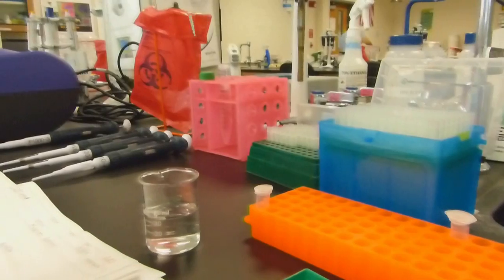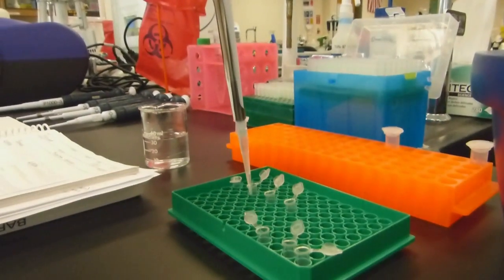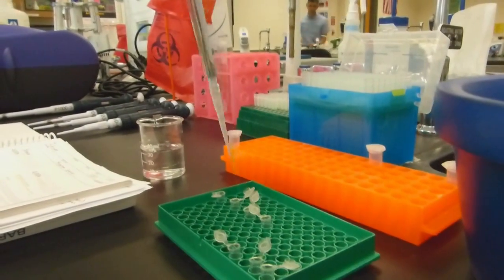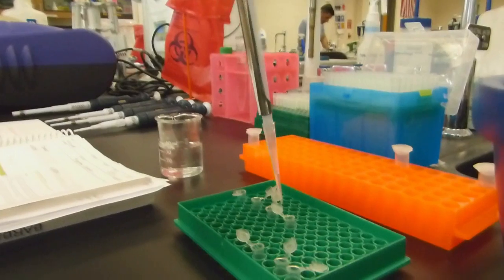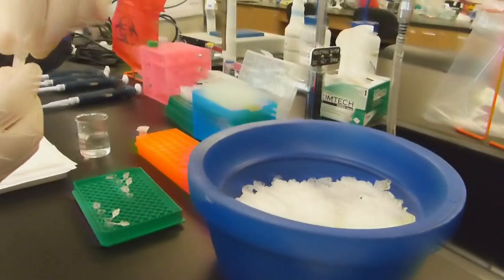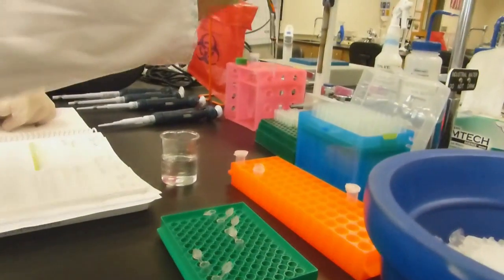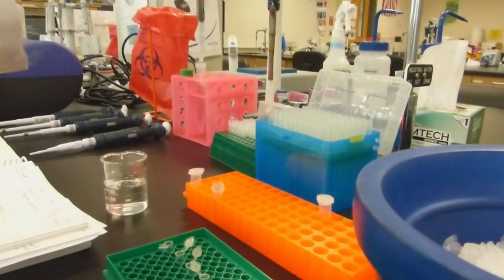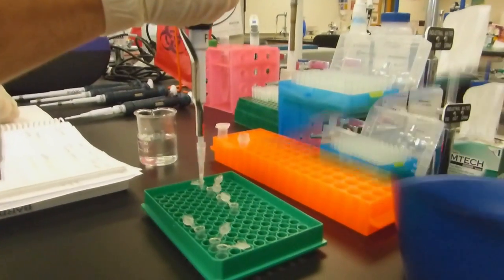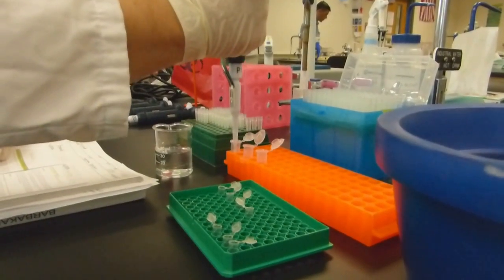Now it is time to load our tubes with everything we need for the PCR reaction to take place. Simple. Each of the 4 samples we will be testing for contamination will get exactly the same mixture. Here, we are first loading each of the PCR reaction tubes with 35 microliters of deionized water. Next, 10 microliters of the reaction mix that has the primers and dNTPs necessary for PCR to occur will be added. Make sure to change the pipette tip for each tube to avoid contamination of the reaction mixture.